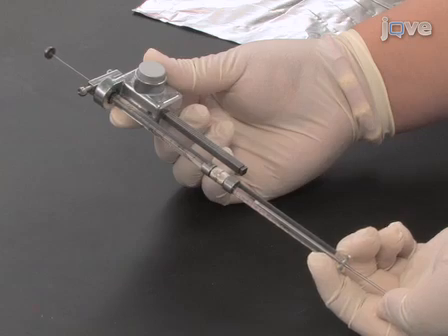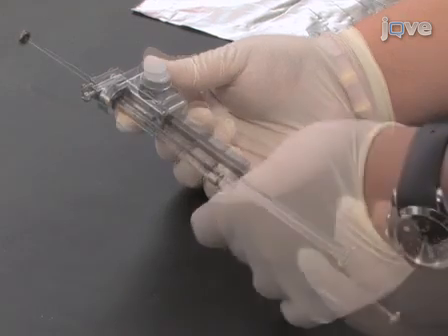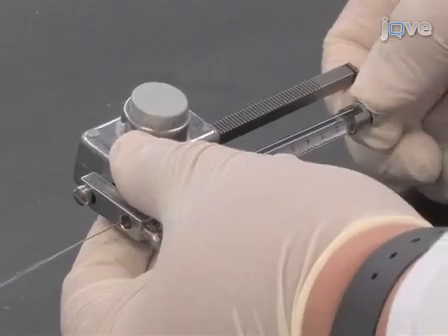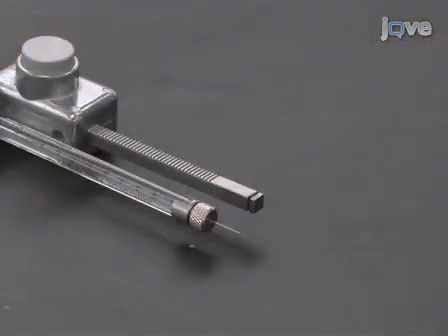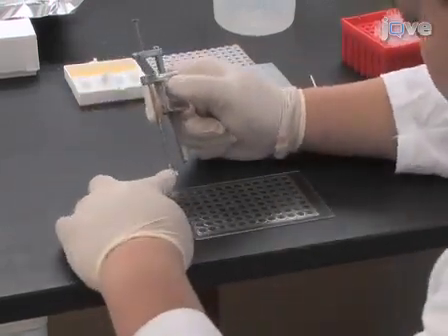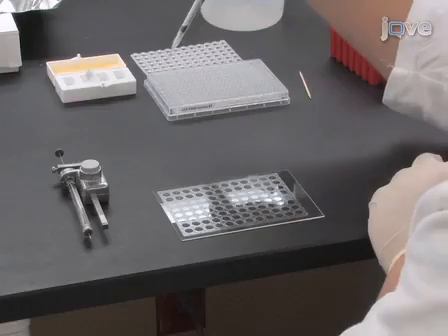Set up assay plates using LCP-FRAP screening solutions by first transferring the protein-laden LCP into a 10 microliter gas-tight syringe attached to a repetitive syringe dispenser. Then, attach a short removable needle to the 10 microliter syringe. Dispense 200 nanoliter boluses of LCP on the surface of 4 adjacent wells, forming a 2x2 square.